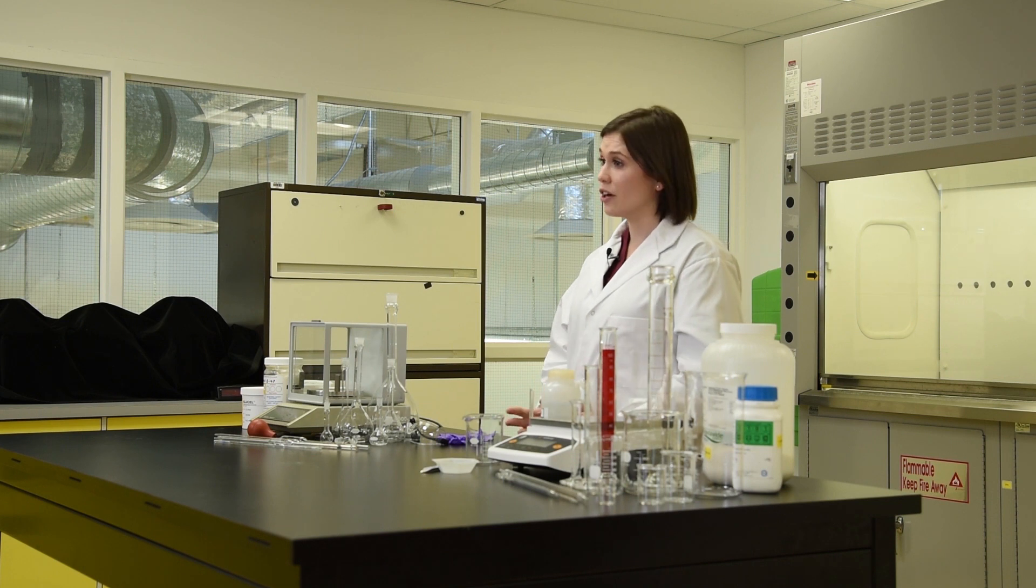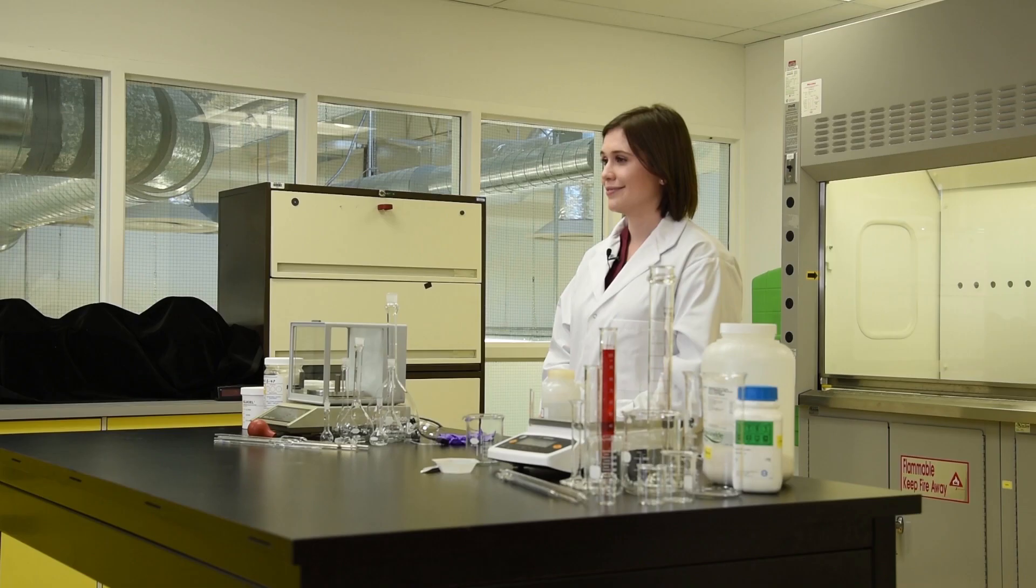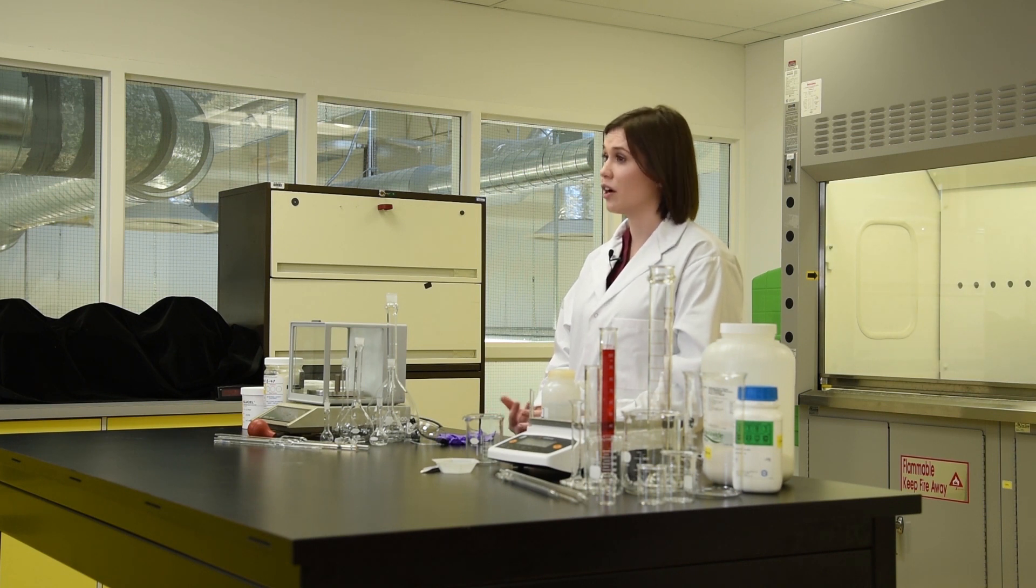As conservators, we don't always need the most exact concentrations of solutions, but there are instances where accurate and precise solutions are necessary - like when preparing a set of standards, experimenting with different concentrations of a chemical, or publishing a treatment method. In this video, I'll be demonstrating the proper technique for preparing precise solutions.